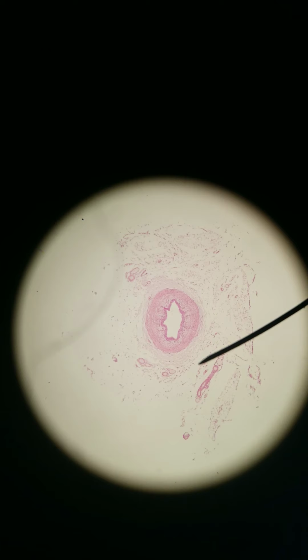Now that we're getting to the tract where urine is flowing out, urine can create pressure and so we need some stretch. So here is pretty much the only place where we find transitional epithelium. Starting in the minor calyx to major calyx to the renal pelvis.